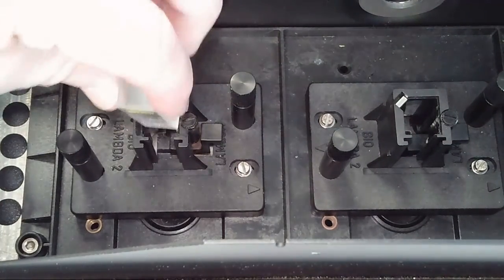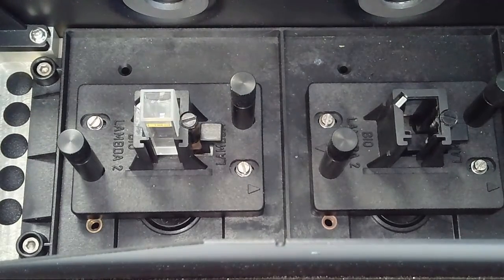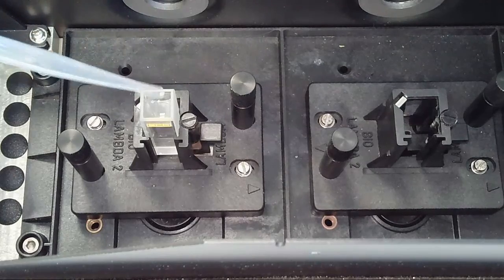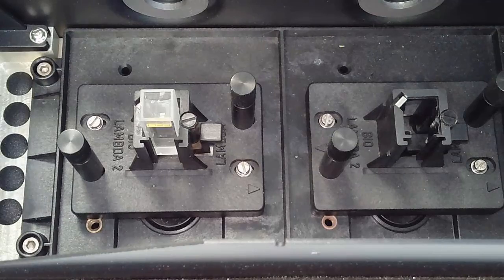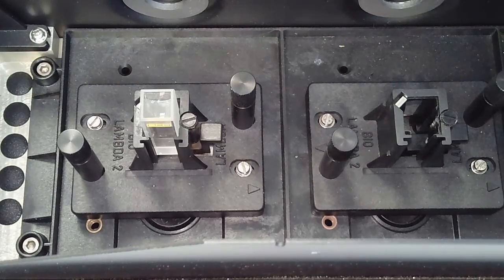And so what we're going to do is put our sample into that cuvette holder. Okay. Now the light is coming from over here, and it's going to pass this way through the cuvette and continue on to the detector. Okay. So we want to make sure that our clear sides are the paths that the light is going to. So that looks pretty good.